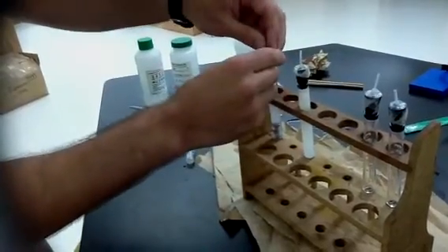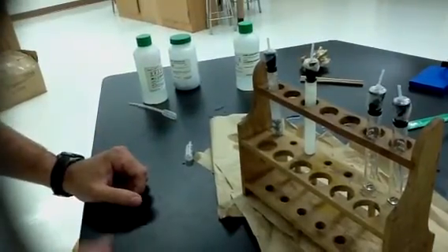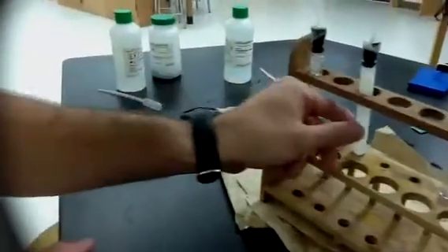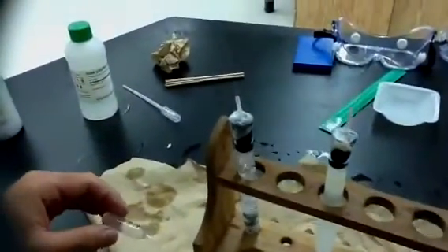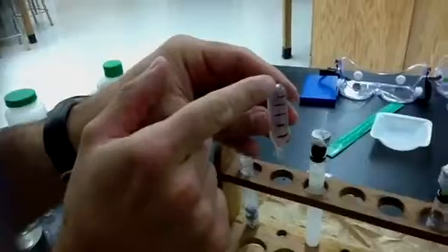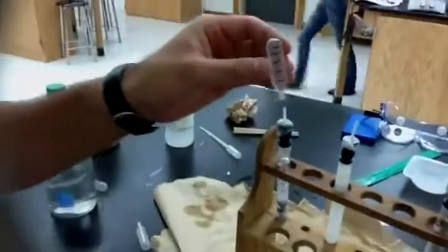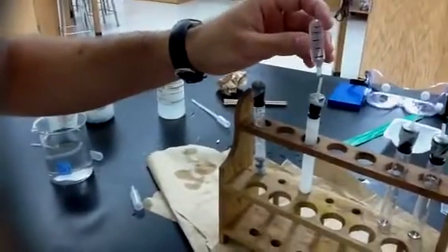I'm going to let these go for about a minute so that they get all the air out of the test tubes. We can see, look at this, you can see smoke coming out of this one. This is hydrogen gas being generated, and here we have oxygen gas being generated. Okay. Now, I'm going to go ahead and start filling with gas. I'm going to try to see if a 1/6 oxygen gas, 5/6 hydrogen gas mixture will produce some kind of combustion reaction. So let's see what's going to happen here.